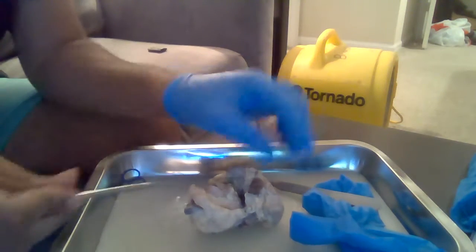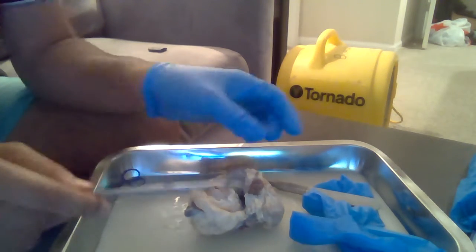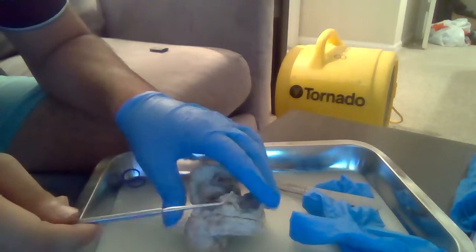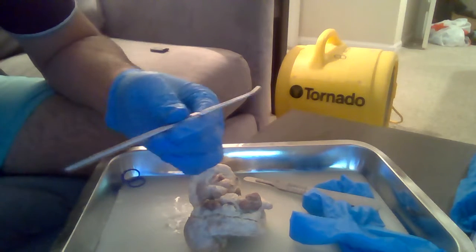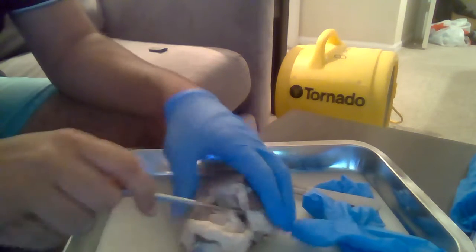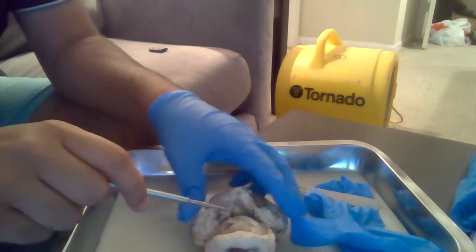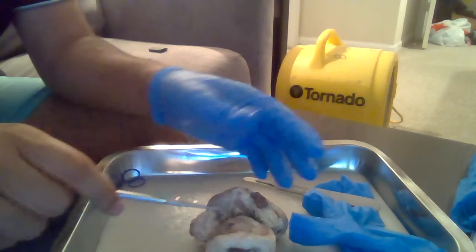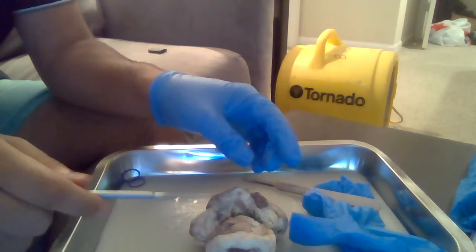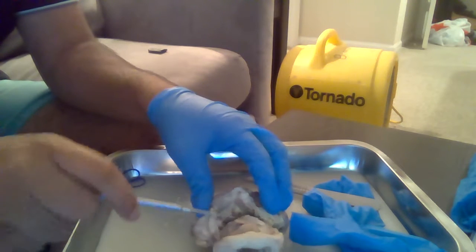Alright, so the eye has very different structures all around. First, I'll identify the optic nerve, which is in the back of the eye, and it helps transfer visual information from the retina to the vision centers. The extrinsic eye muscles are all around the eye, right in front of the optic nerve, and they help the eye rotate and move horizontally or vertically.